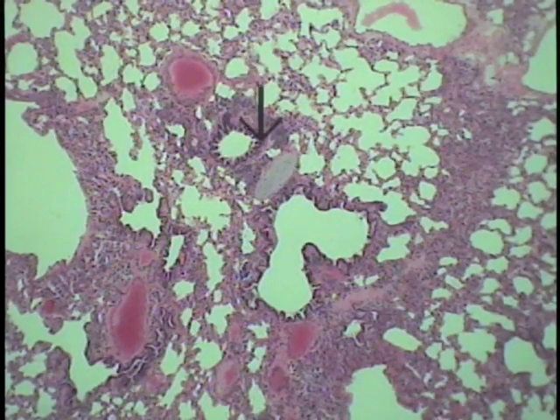A tertiary or small division of an intrapulmonary bronchus is shown at the tip of the pointer. It's one of the terminal segments, so it's down at the tertiary level just before it becomes a bronchiole. It can be identified by a supporting bit of hyaline cartilage, and when we go down and look at it at lower power, one can still see bronchial glands coming into the supporting wall.